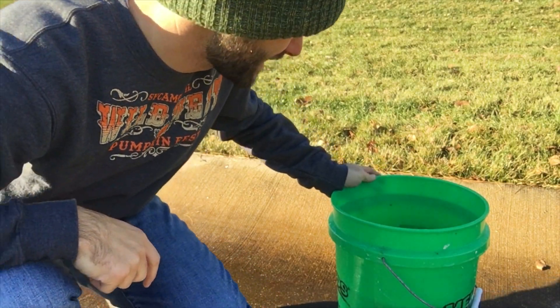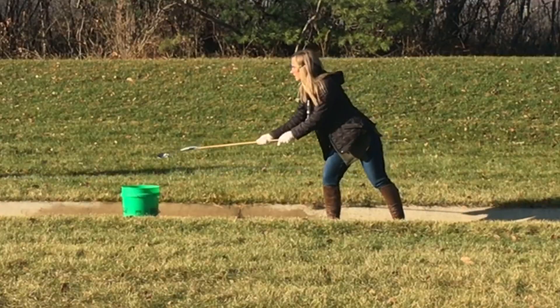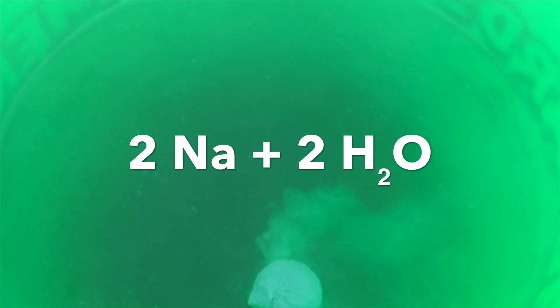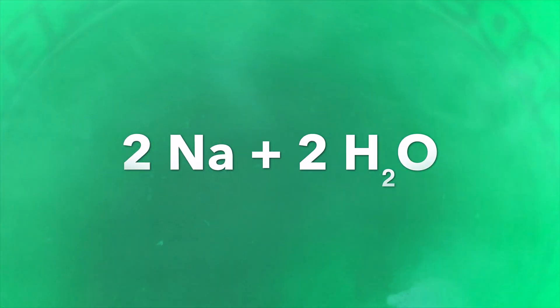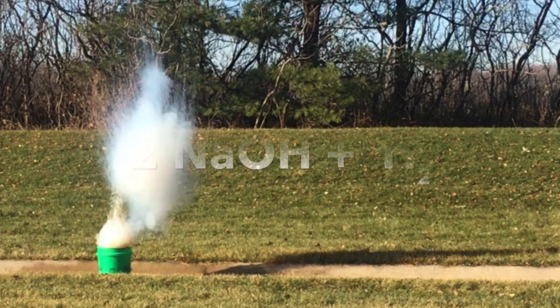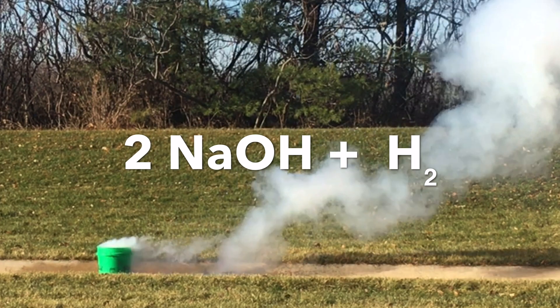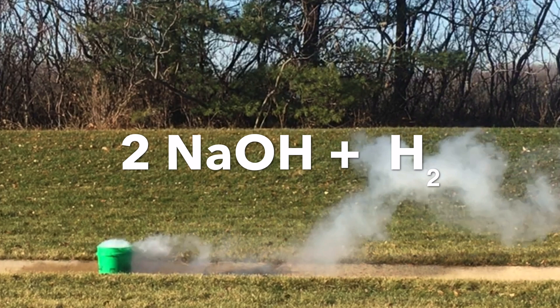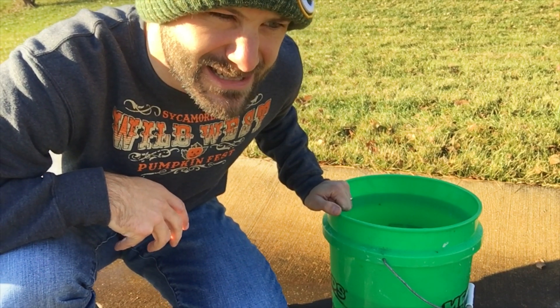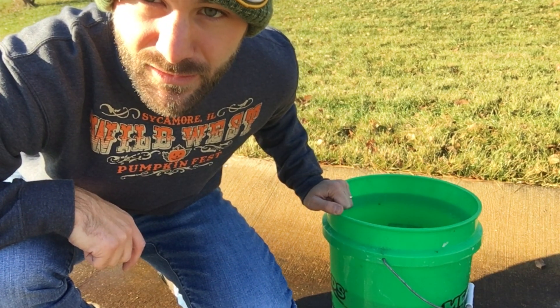How cool is that? So anyway, I'm not sure if you can see it, but there's kind of a gray film inside that bucket, and then there's some gray stuff all over here. When sodium — when we drop it in the water — what happens is, as it reacts with water: Na plus H₂O is going to give us products. Our reactants are sodium and water; our products — what we get created or generated in the process — is something called sodium hydroxide, which is kind of a grayish powder, which explains the color of the smoke that you see, as a lot of those particles are going up into the air. And then we do get H₂, which is hydrogen gas, released as well. You can't see that because the gas is invisible to our eyes, but it's going up into the air. That was science — have a good day everybody.